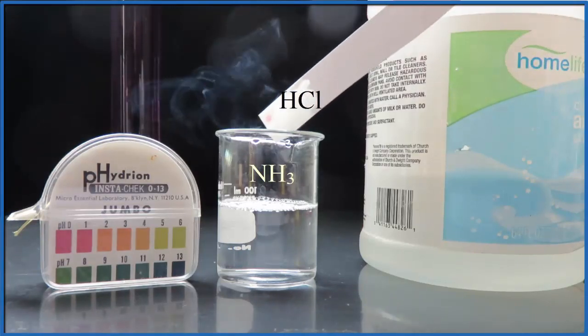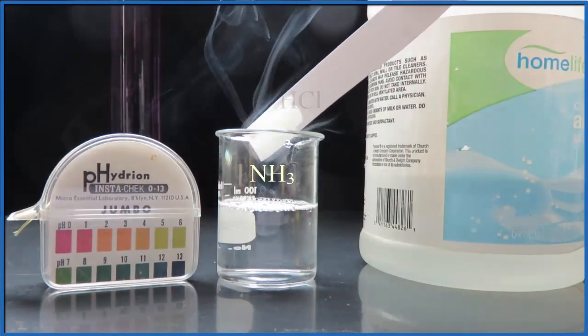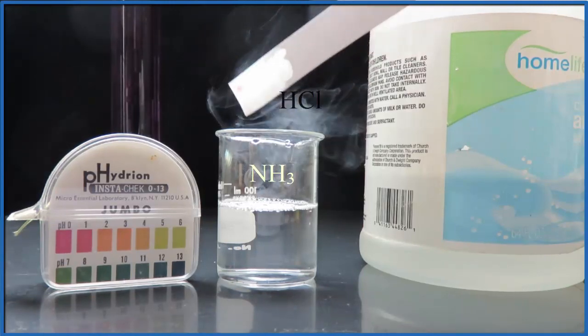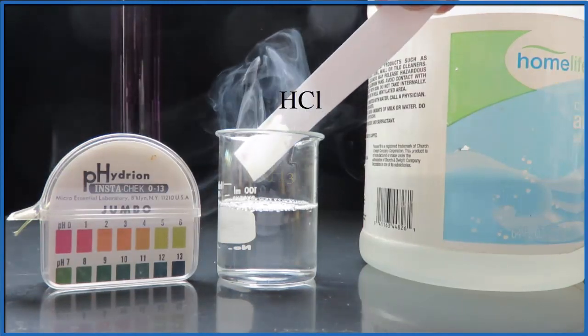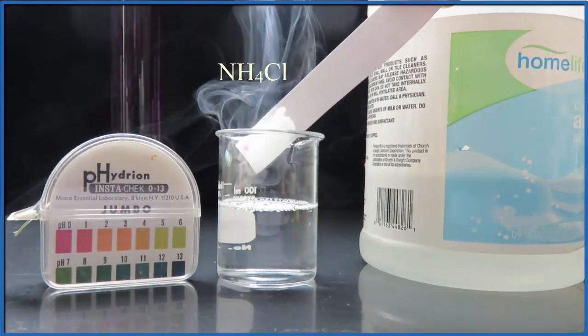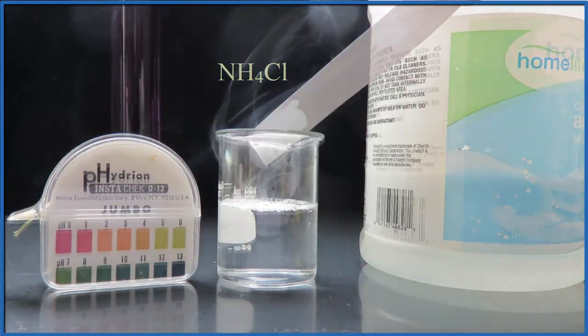You can see the ammonia gas coming out of the solution. It's reacting with the hydrochloric acid and that's that fog or smoke that you're seeing. It's called ammonium chloride.